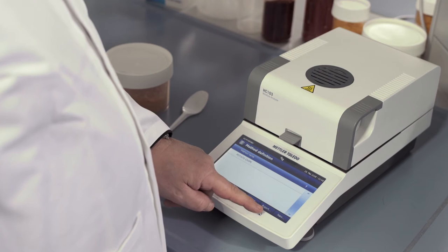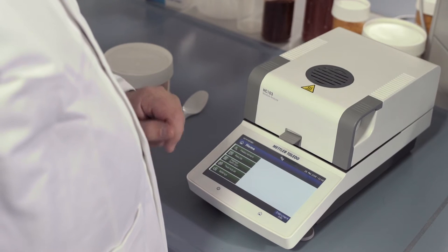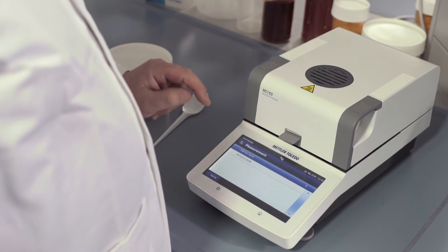We go back to the Home screen. We press Measurement and select the method.